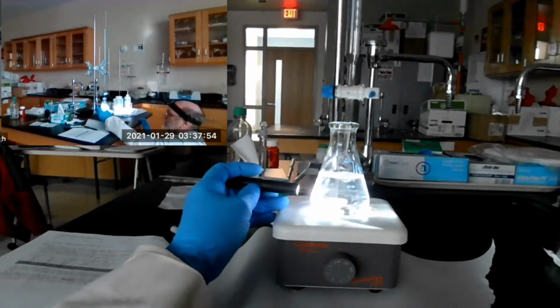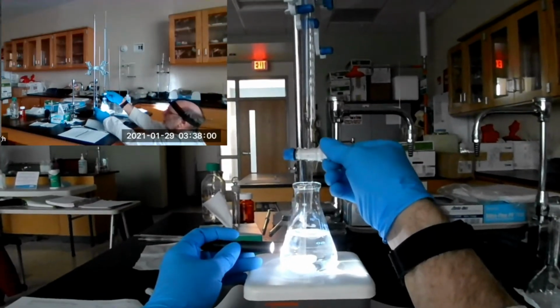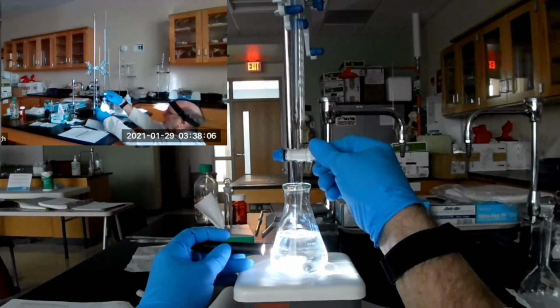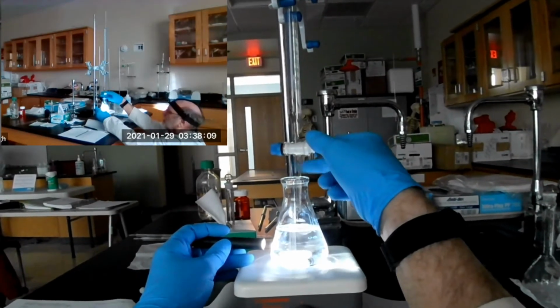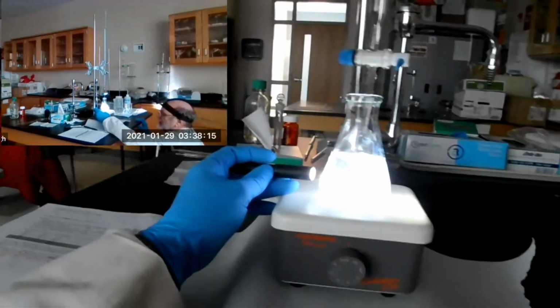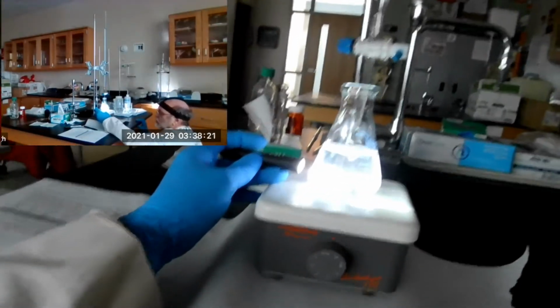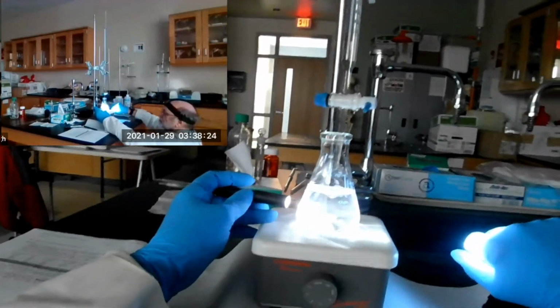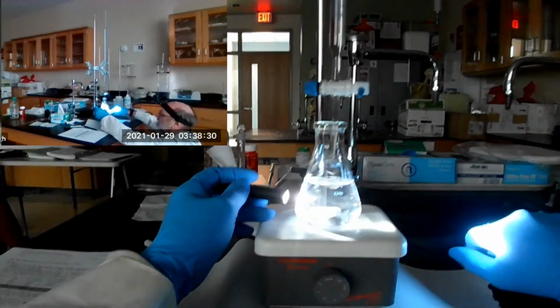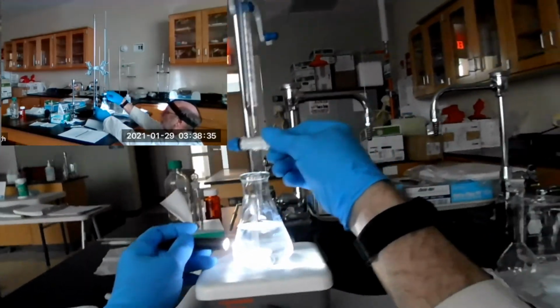All right. Let's see, can I see the light beam? Not anymore. It's gone. So let's try another one. There it is. Come on, there you go. Notice I tapped the tip. That makes sure that the drop that fell off is all that was delivered, and we didn't have anything clinging on the tip. Okay, I can see the light beam still. It's fading, fading, gone. Let's add another drop.